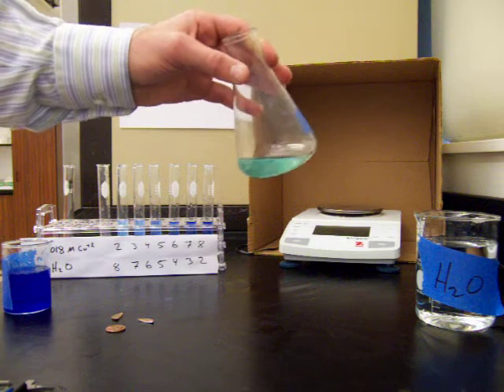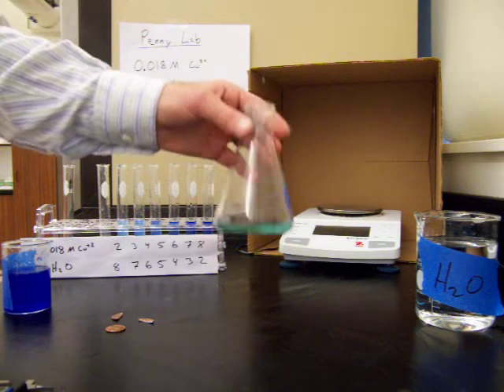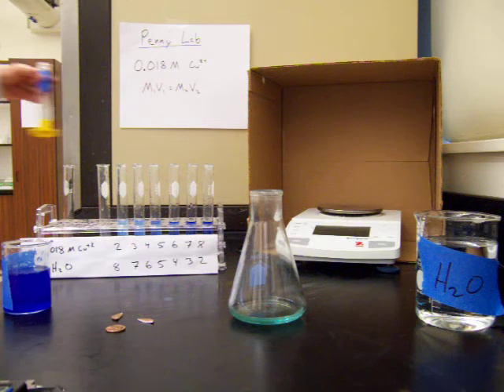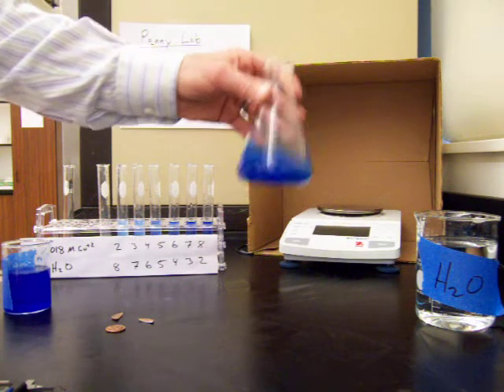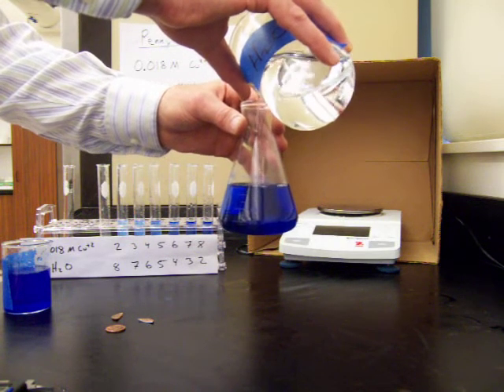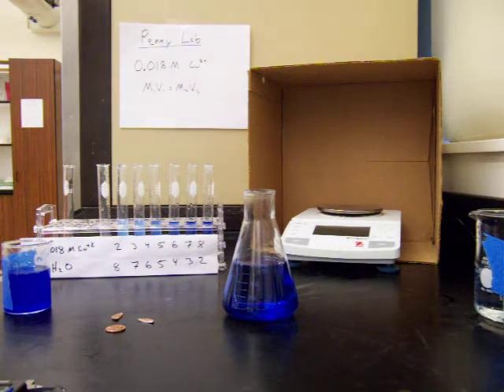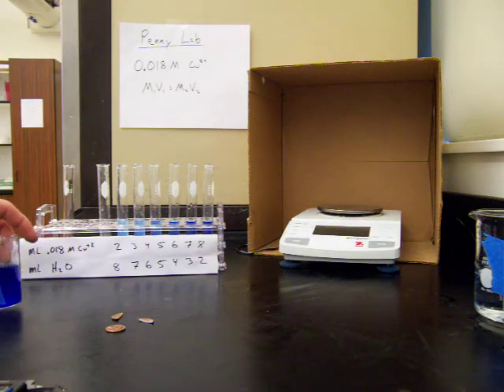We're going to use this color to determine the molarity of the solution and how many moles of copper were in the penny. First, we'll intensify the color by adding a little ammonium hydroxide to the penny solution — this isn't adding more copper, just intensifying the color. It turns a nice dark blue, which makes finding its molarity easier. We then dilute the volume to a total of 200 milliliters by adding water.